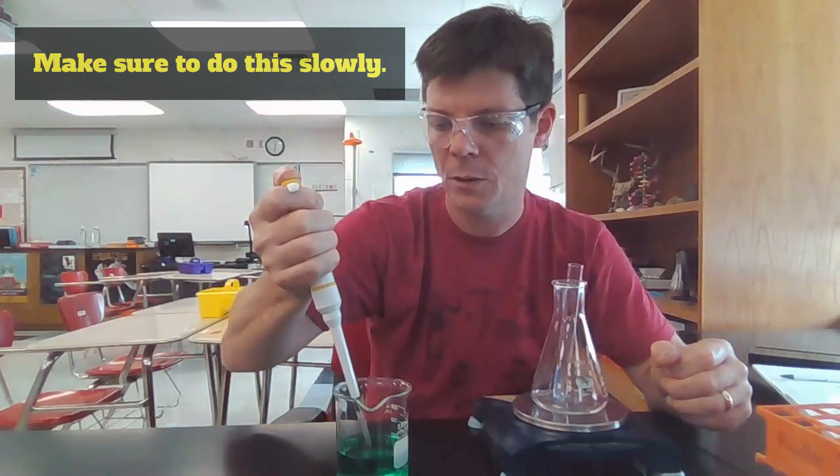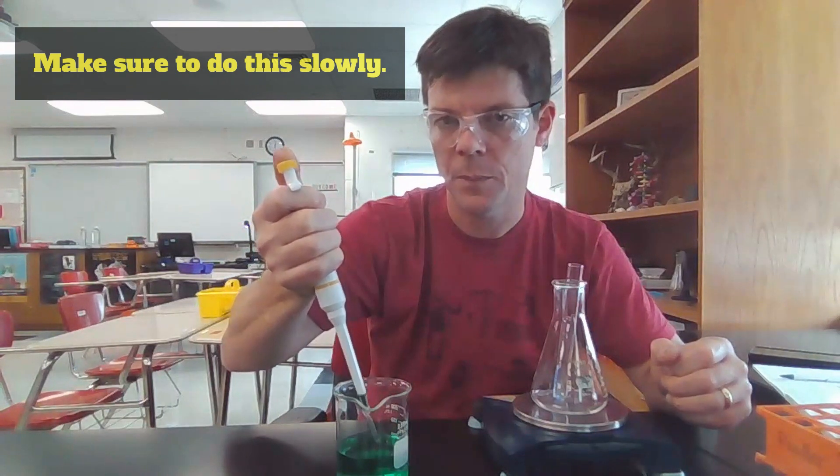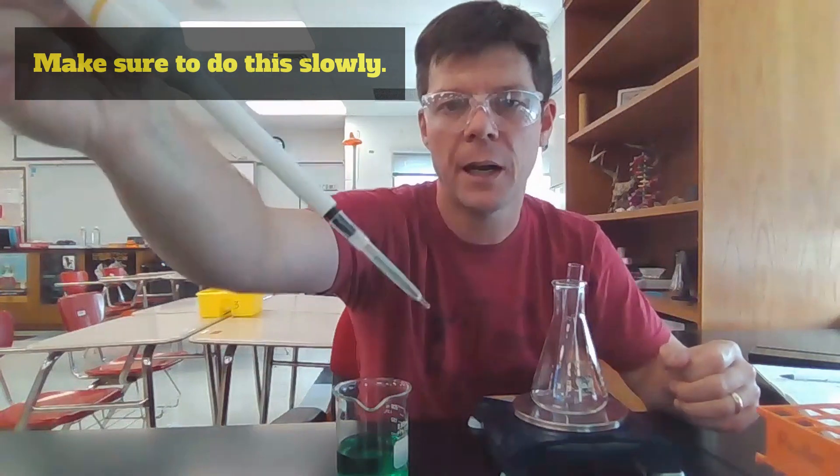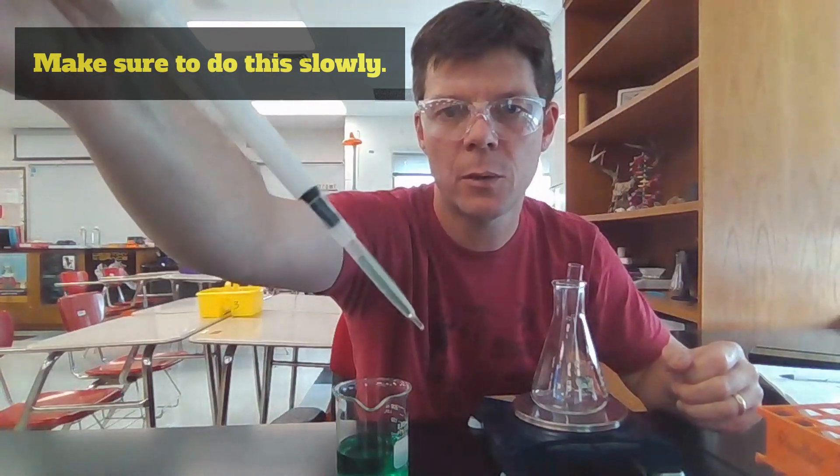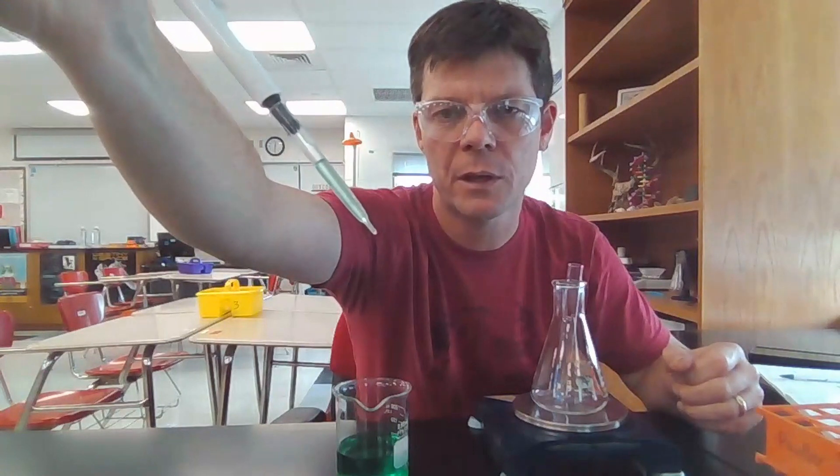I'm then going to allow the plunger to come up by releasing my thumb. And you can see now that I have transferred liquid into the tip of the micropipette. I think that's a good angle where you see it right there.